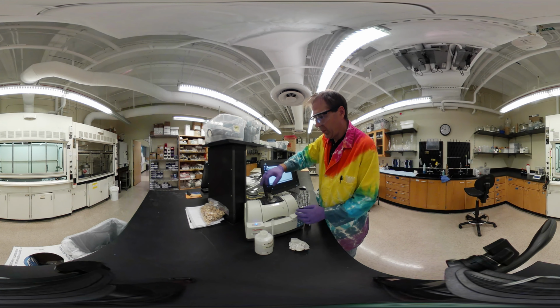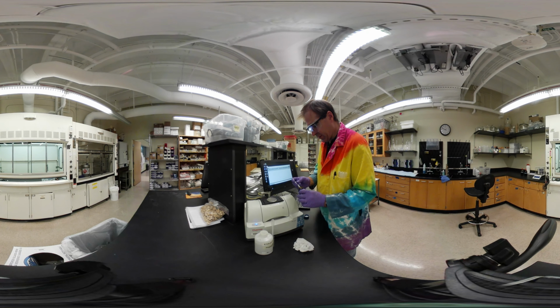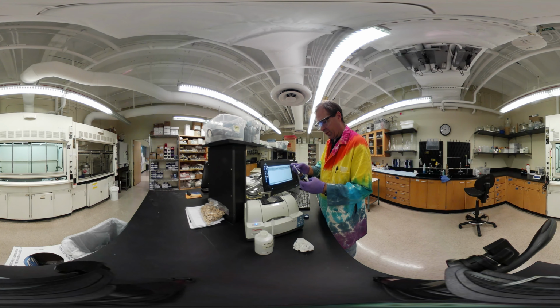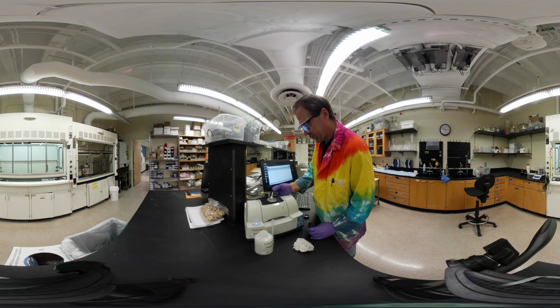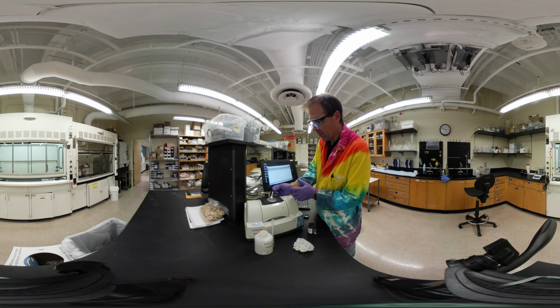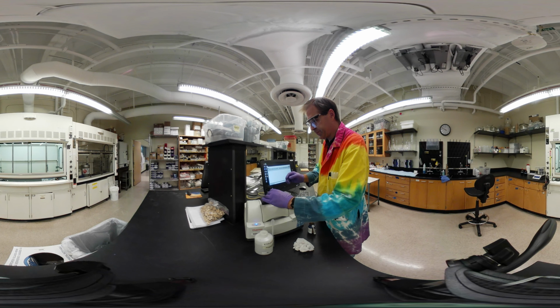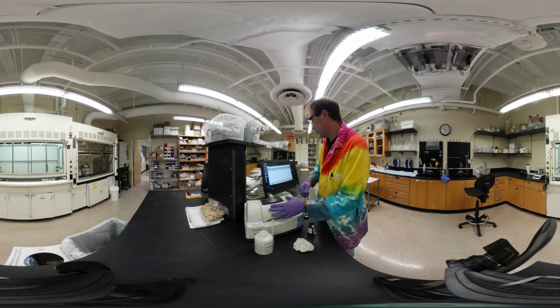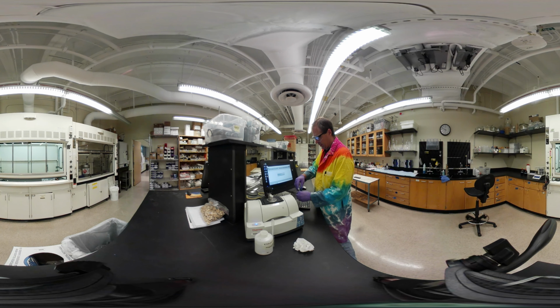All right. So we're doing a solid again. So we're going to take a little tiny bit of our solid. This is the 3-nitrophthalic acid. Put it on there. To make sure there's good contact, put that down. All right, so we're going to go collect a sample and put a lid back on.